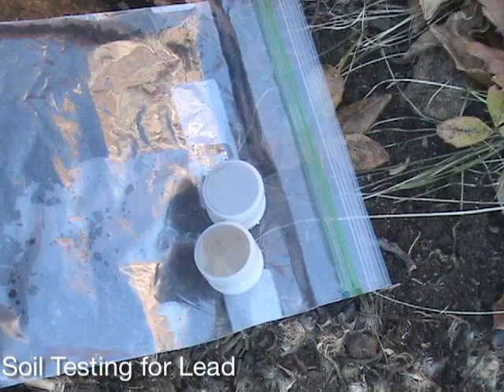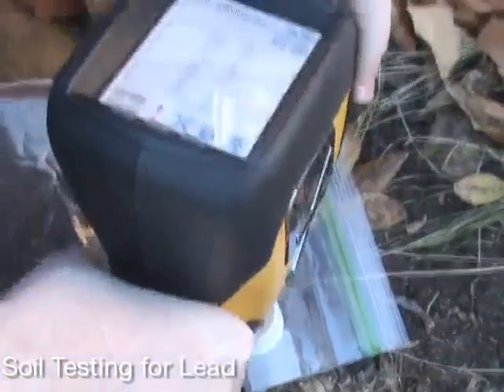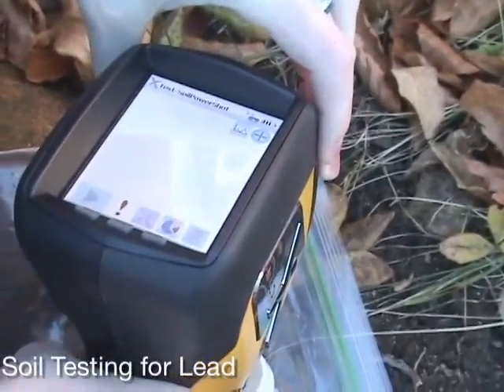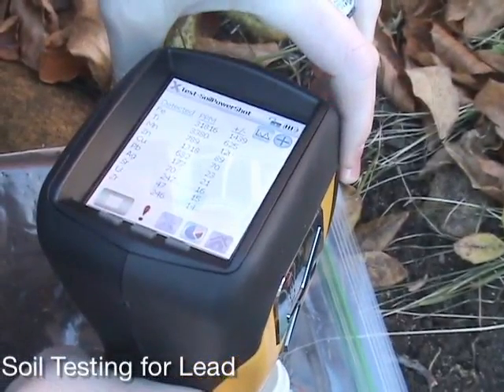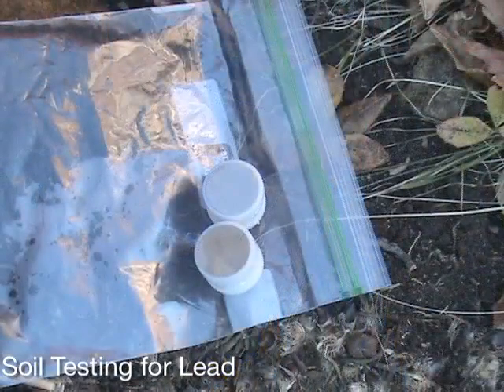This requires that it be dried, pulverized, and sieved to provide a homogeneous sample with a flat surface. Since XRF is non-destructive, this same sample can be sent to the lab to correlate with ICP measurements.